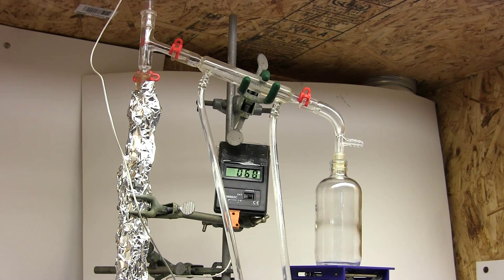And here we are with just fraction two being distilled and the column has been wrapped in aluminum foil. Since lowering the heating resulted in the vapors condensing out before they could reach the top of the column, by insulating the column they'll retain heat better. The drawback of this approach is that the column is easier to overload so you have to go even slower. But since we want to go slow anyway to get better separation this shouldn't be a problem. And there we go.